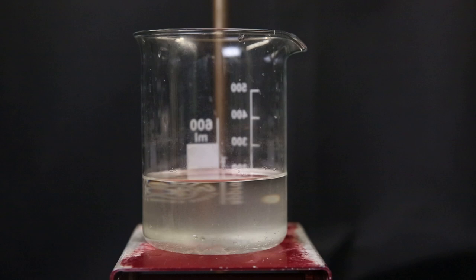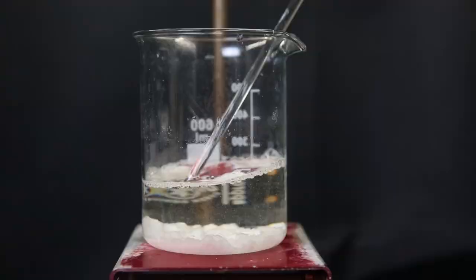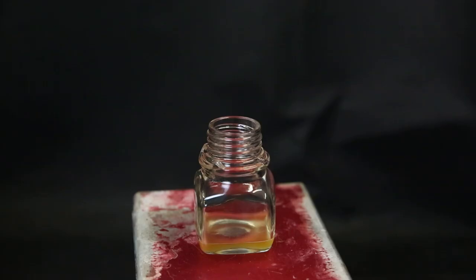To remove any remaining water that is inside of the hexane, I add in some sodium sulfate to dry it. And mix it around a bit and let it sit for a while. And then filter it through some cotton to leave behind the salt. Now that everything has filtered through, I set it up for a simple distillation to boil off all of the hexane. And afterward, I am left with only a few milliliters of oil, which I put into a vial.